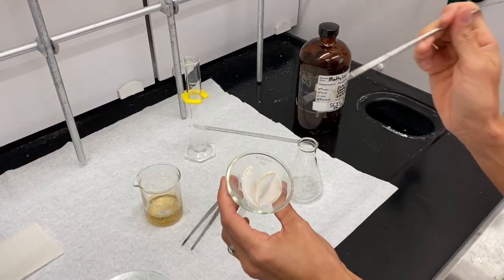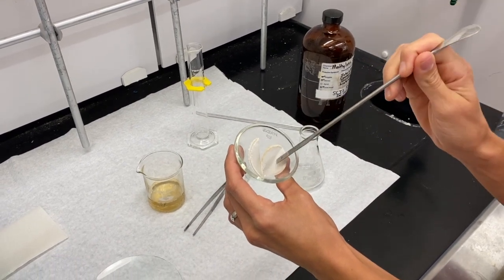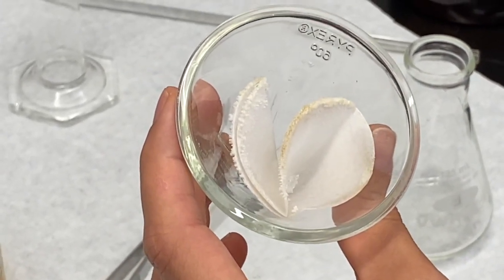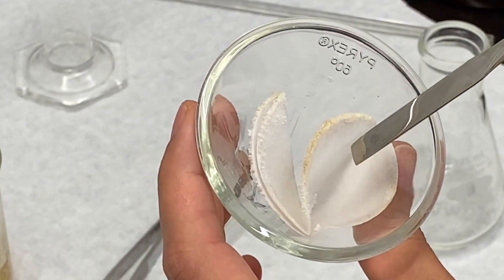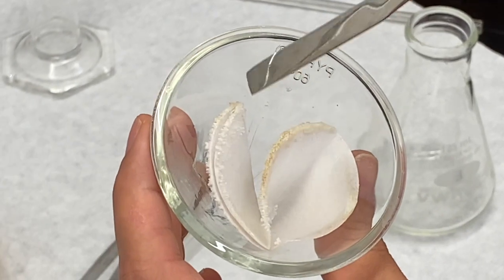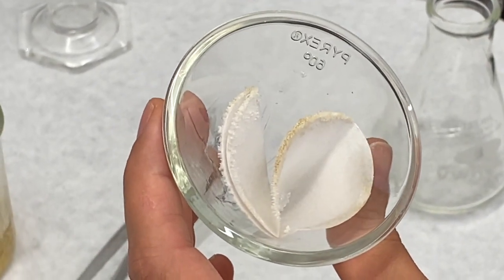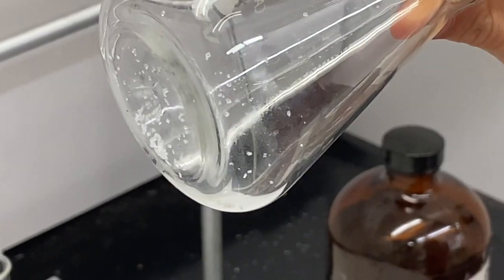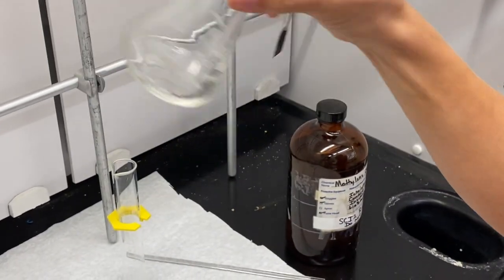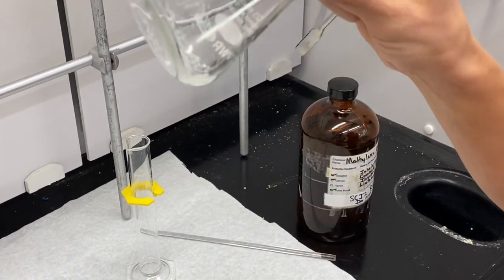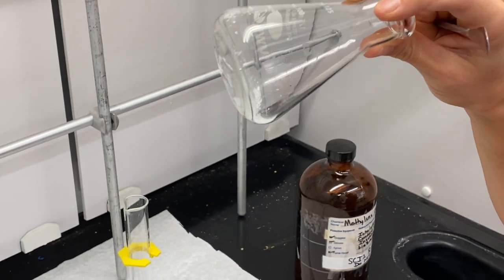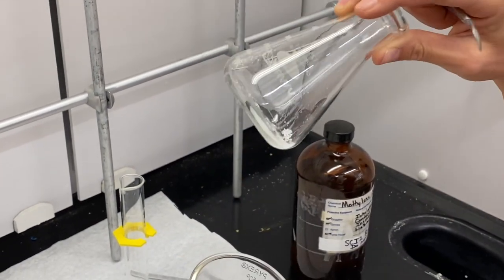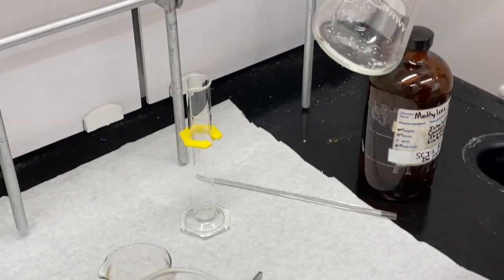Currently we've separated our solution from the material that hasn't dissolved. You can see we've got a few crystals down here in the bottom of our filter paper, and we also have some residual crystals that as solvent has evaporated has left these crystals up on the top of this cone, which do seem to look different than what's in the bottom. Also, when filtering, not all of that material has transferred. The alternate thing you can do instead of just trying to rinse constantly is you can wait for the inside of this to dry. Organic solvents dry typically really fast, so we can use a spatula to scrape away this material and put it into our filter paper to dry.